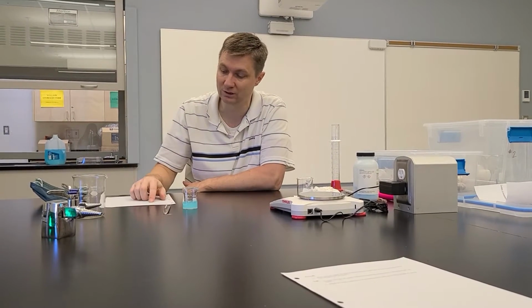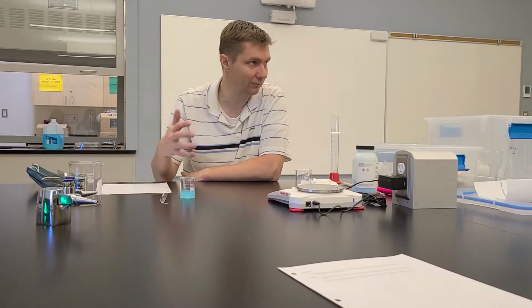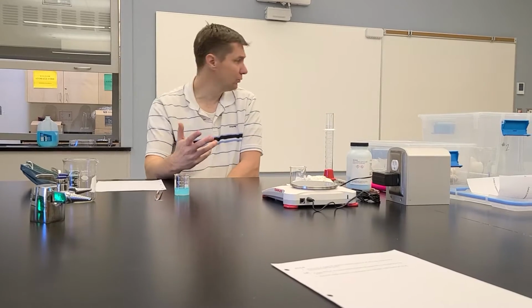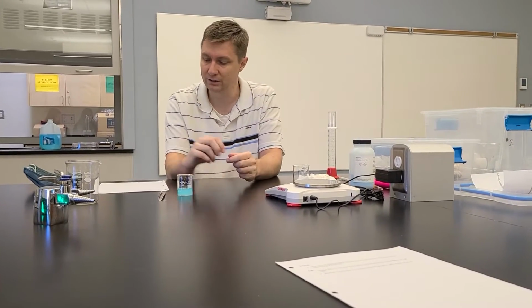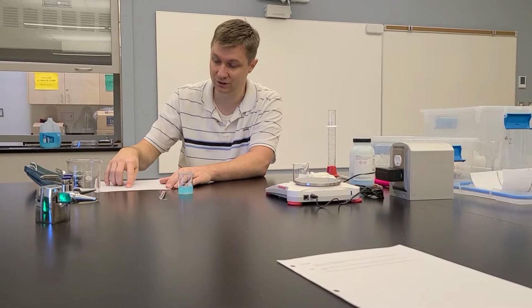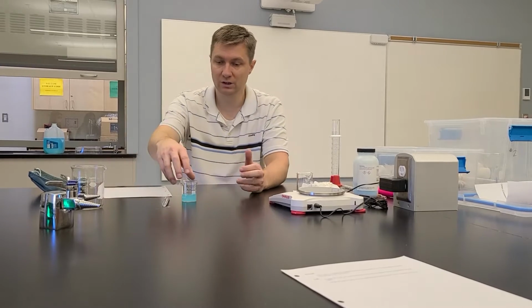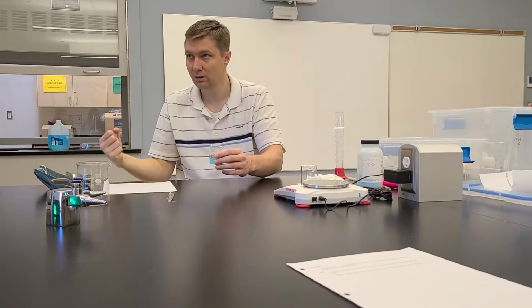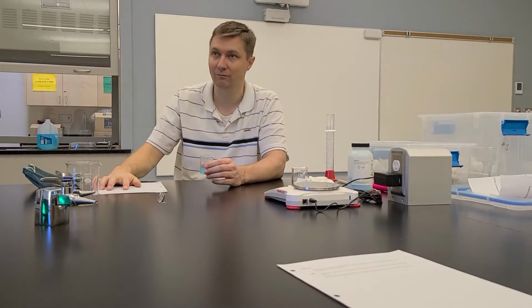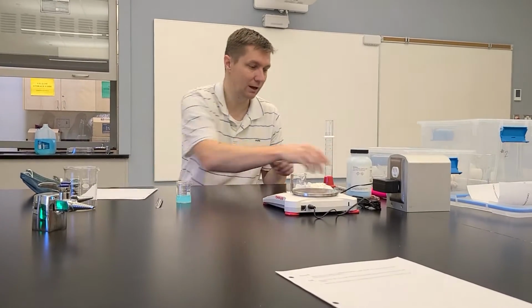Now step 2 here is the actual dilution. It wants you to dilute the stock solution to a concentration of 0.1 moles per liter with a volume of 150 milliliters. So when you do this, you want to make sure that you're using that C1V1 equals C2V2 formula, okay? And because this is your C2, the 0.1 moles per liter, and the 150 milliliters is your V2, you need to know how much of this you are going to pipette out in order to get that concentration with that volume. Does that make sense? So you do your calculation with that, and again, you can check that with me before you carry on.